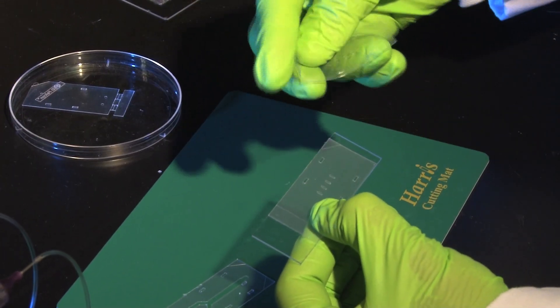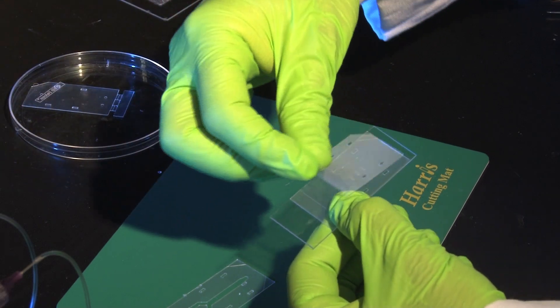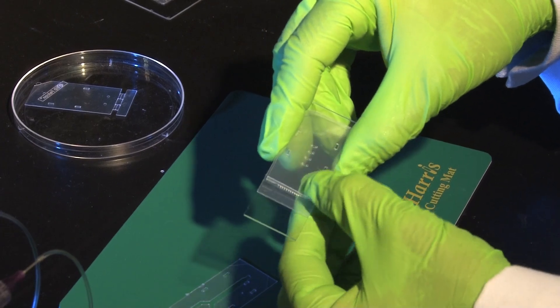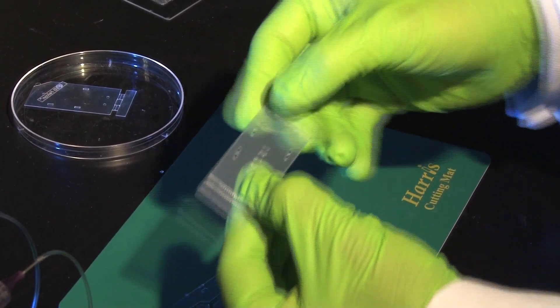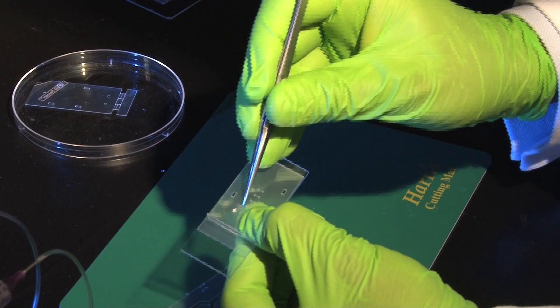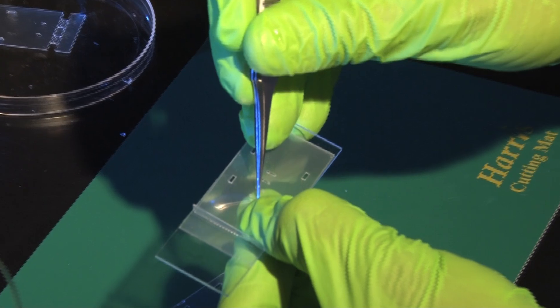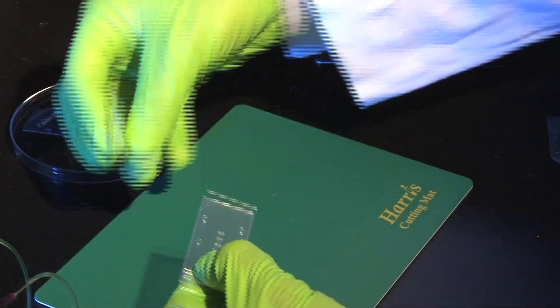On top of this we align the plastic with the holes so that the holes are exactly at the extremes of each trench. So that way if you look at it you've got the hole, there is a little trench that is connecting to the other hole, and this way is how you form the little channels.